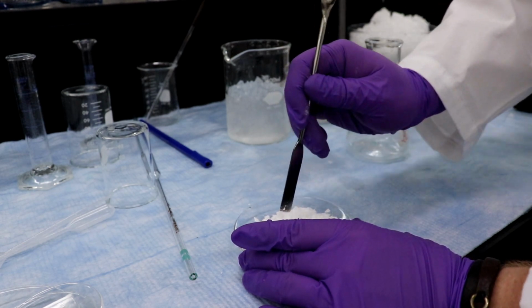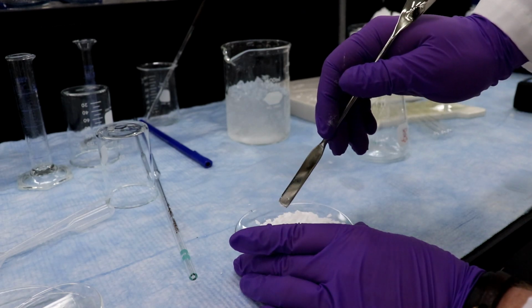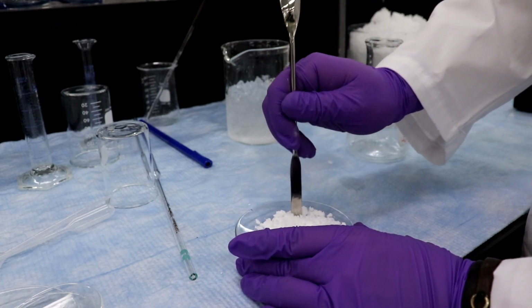Well, look, David, your filtrate is actually pretty clear. Oh, not that cloudy. Might have been... It's probably just all the aeration. Yeah, it's probably just all the air being pulled from it.